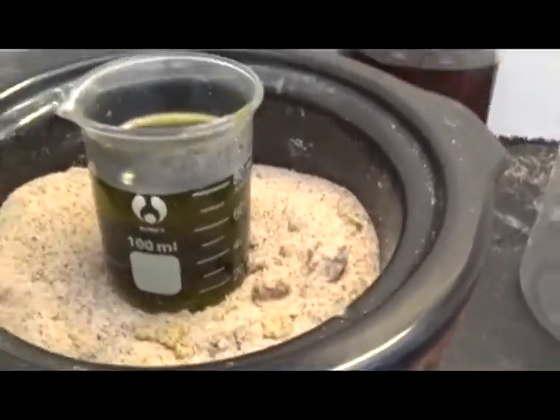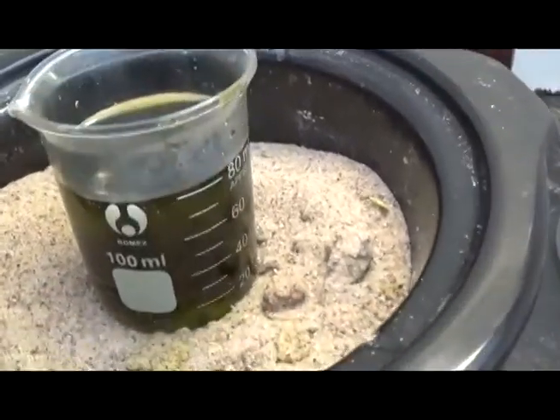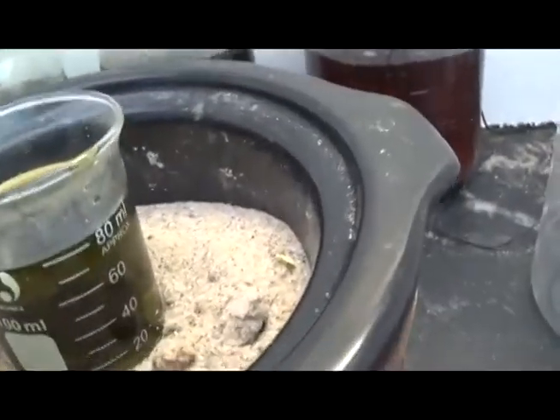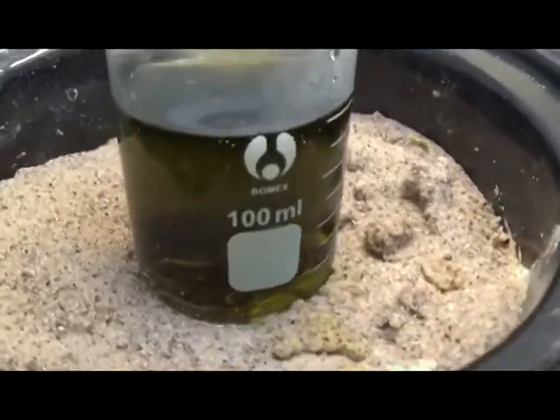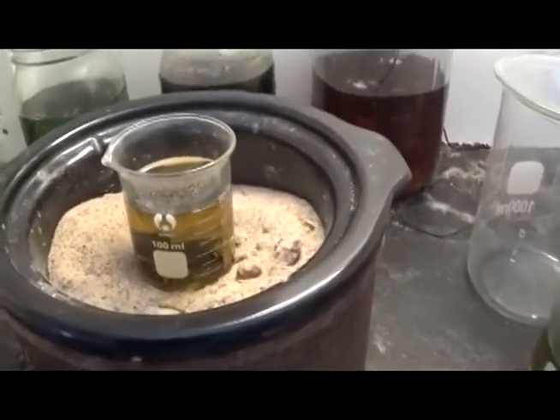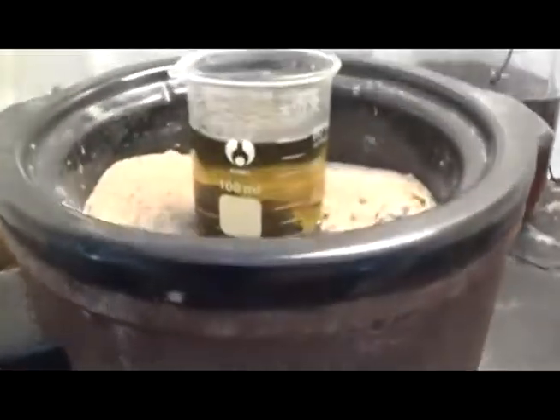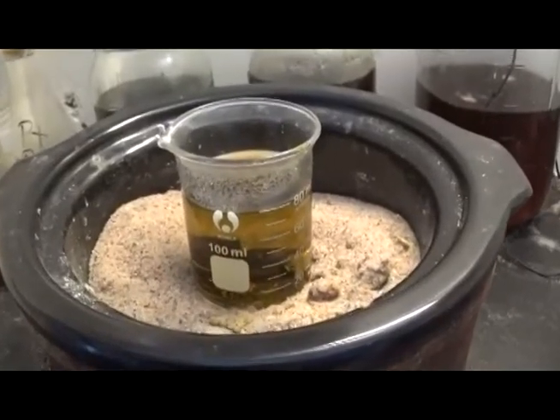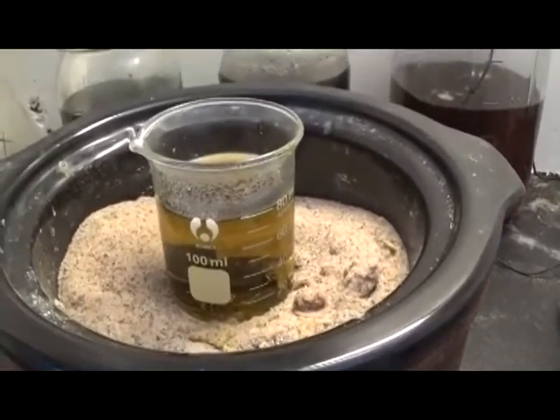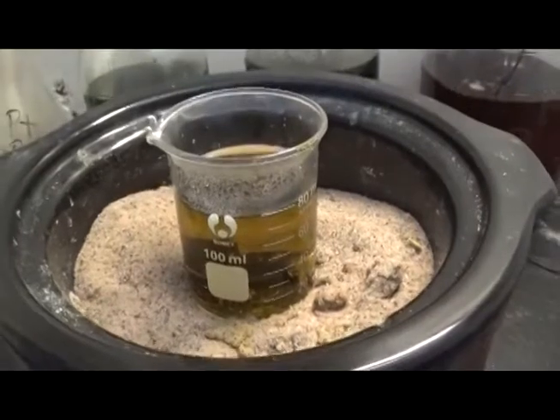Hour 2 — this is promising. Look at the gold foils floating on top. This is what we wanted to see; we wanted to see this get really dark because it's eaten away the copper that is left in this gold-filled material, pulling it into solution. Just not even an hour later from that last update, the solution has changed colors again — a worrisome color. We're going to check and see if we have gold in solution. I guess 6 ml of hydrogen peroxide was too much.